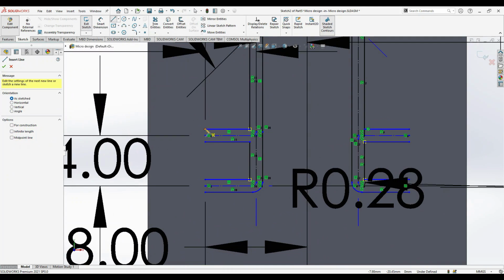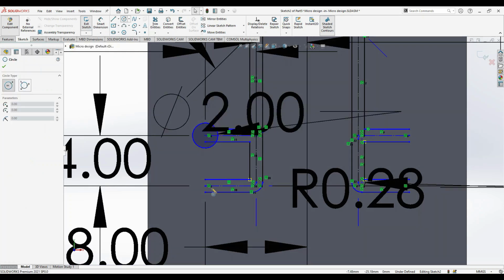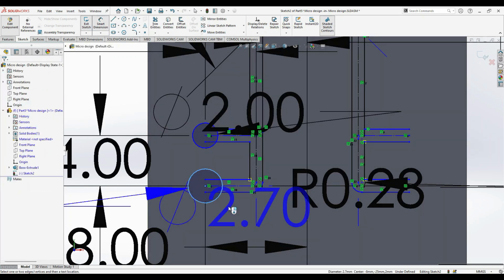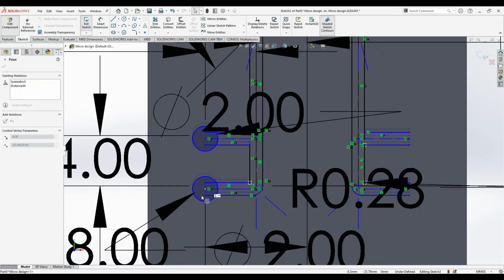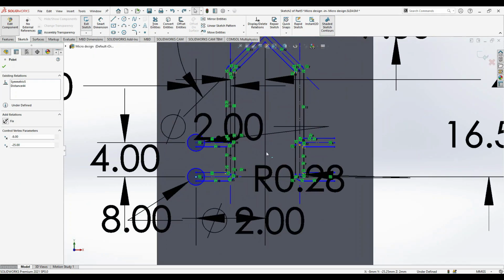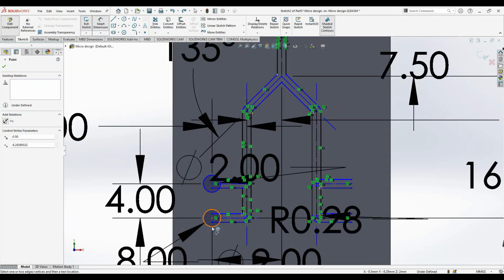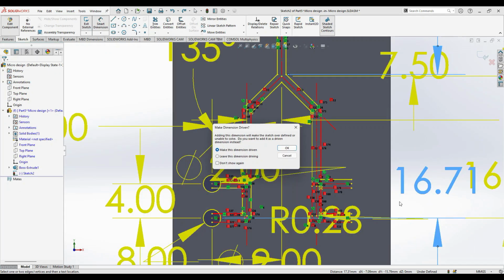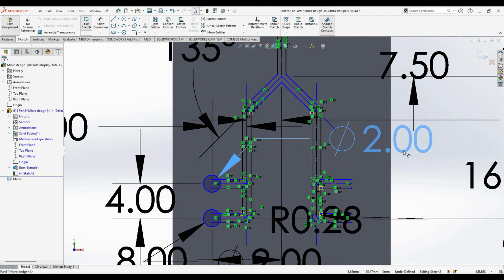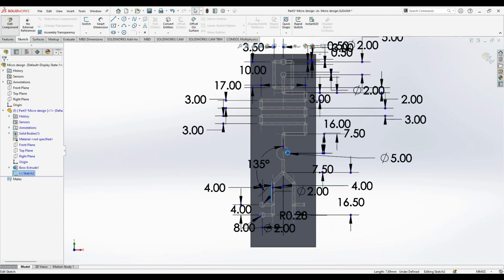When you just close the, you can create an outlet here. So outlet also you can create of 2 mm in diameter, and one more of 2 mm diameter. Okay. And then we see that it can move now, so there is no constraint. Now what we do is, we give a dimension from let's say this end to this end. Okay, so that is making overridden, so don't select it. Okay, go back, edit to sketch.